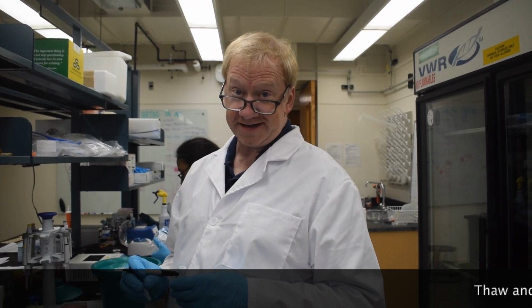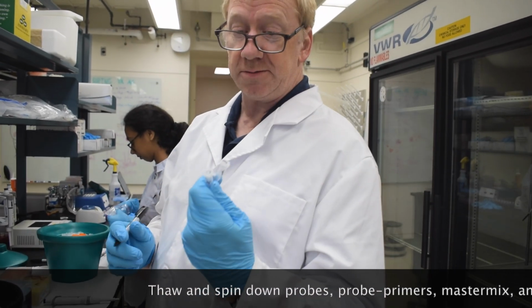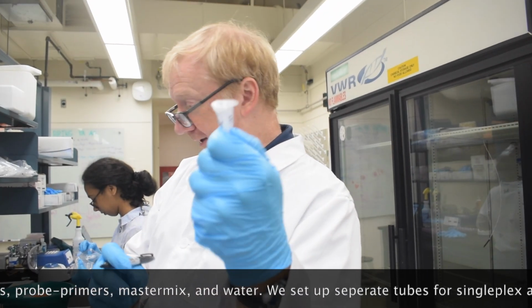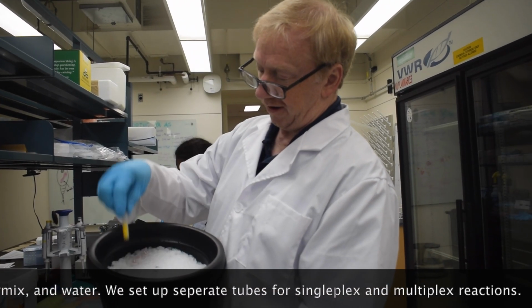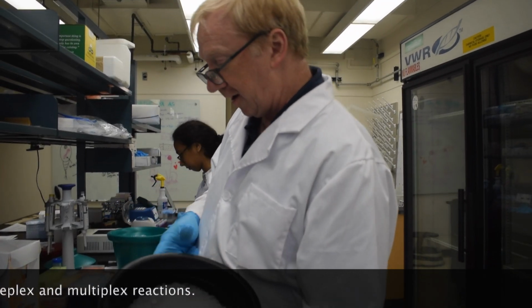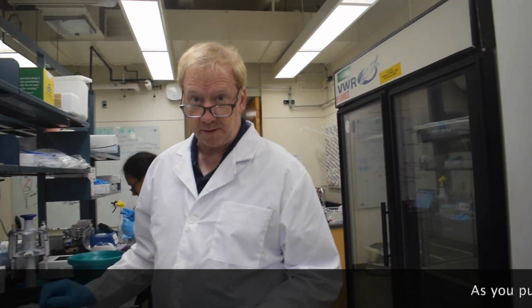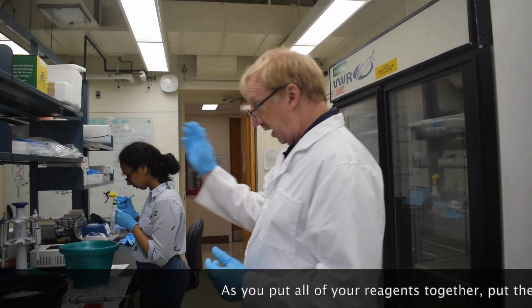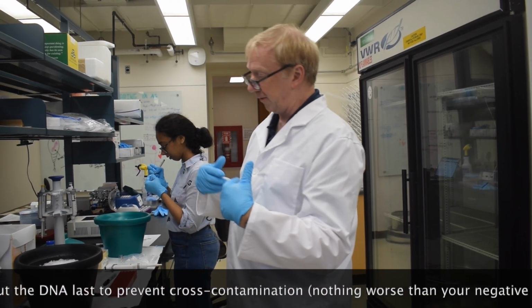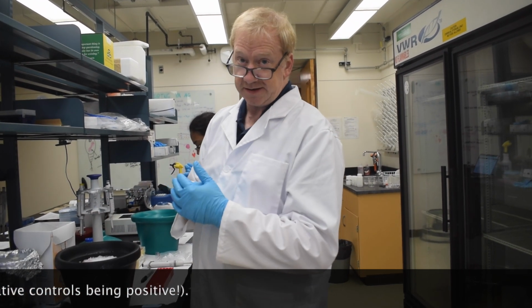So I'm getting ready to set up our singleplex and multiplex reactions. I've got two tubes, one labeled S for single, one labeled M for multi. I do have the water thawed, I have our master mix, and I have the various amplification primers. Where's the DNA? The DNA is over there, away from this workspace, so we have no chance of contaminating it into our master mixes, because that would be bad.